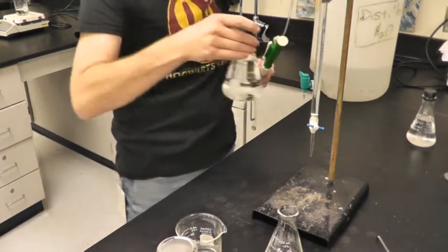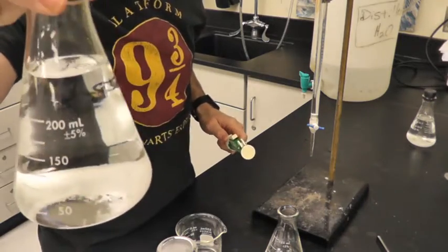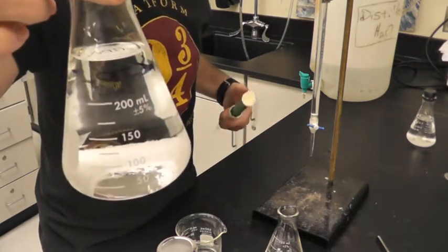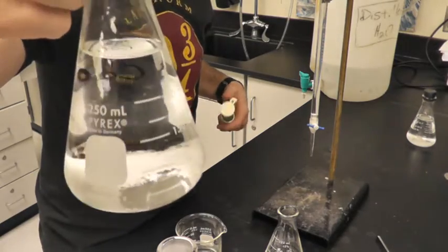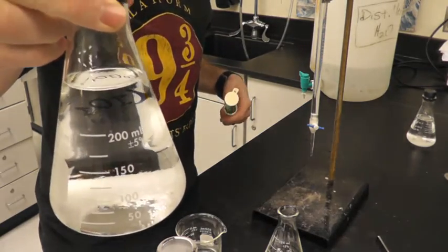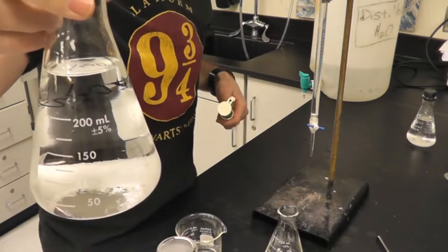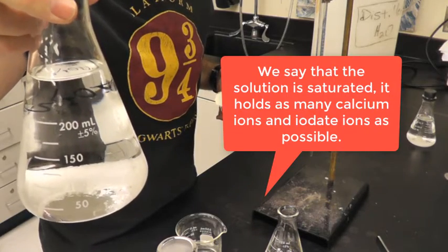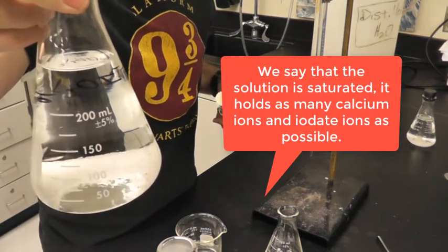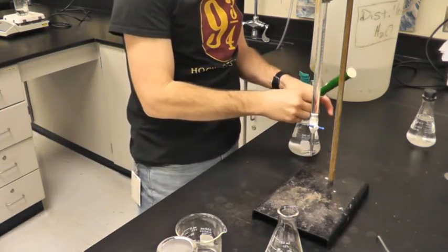And then this is my beaker of calcium iodate. Essentially, it's probably the same thing from about 5 years ago. There is some solid at the bottom. This has been able to get to equilibrium over the past year. So because there's solid in the bottom, I know it's at equilibrium, and as much calcium iodate that can dissolve is dissolved, and that's why there's precipitate left. All right, so this is at equilibrium because it hasn't been disturbed for an entire year.